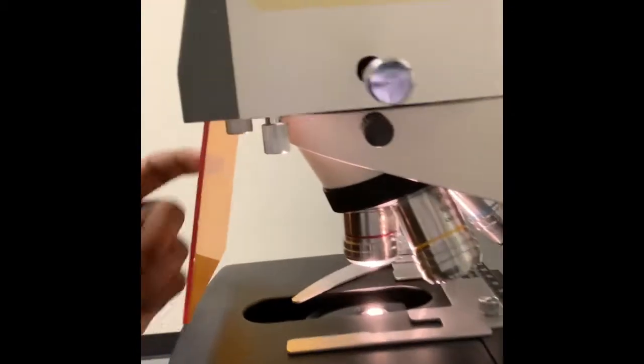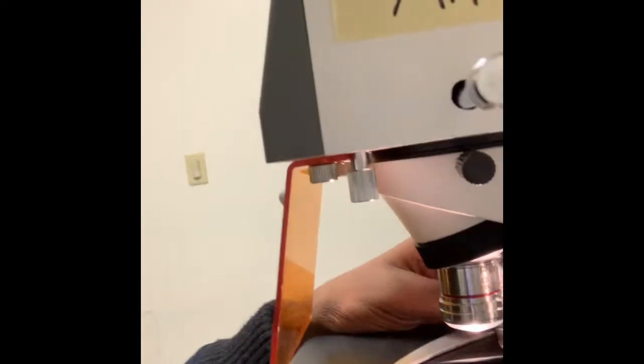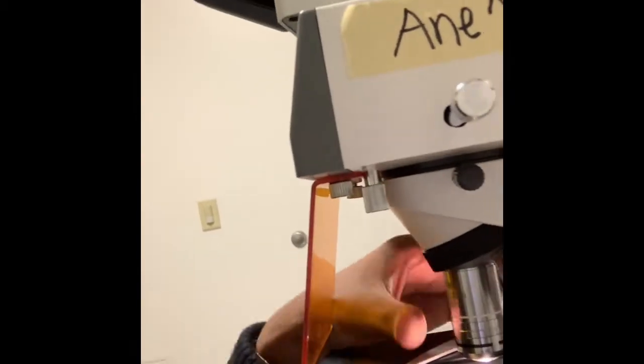Kind of a brief introduction to the microscope: if you're looking at it from the right side like I am, on this side there'll be a power source that looks like this. You flip that and it'll just shoot out regular light, which is how you use it as a regular microscope. And these are the lens adjusters, so if you want to magnify or demagnify, that's how you do that. So with the lights, the power box is going to let the light be emitted through here.